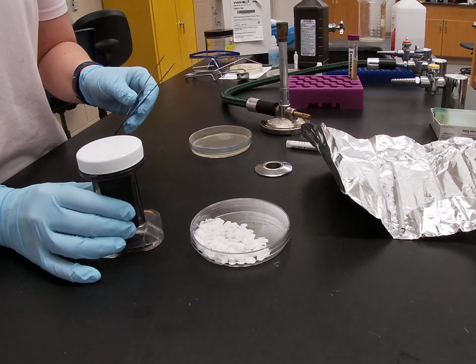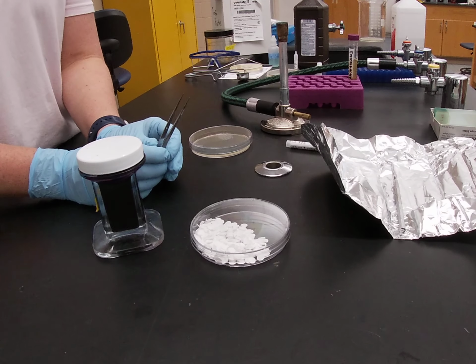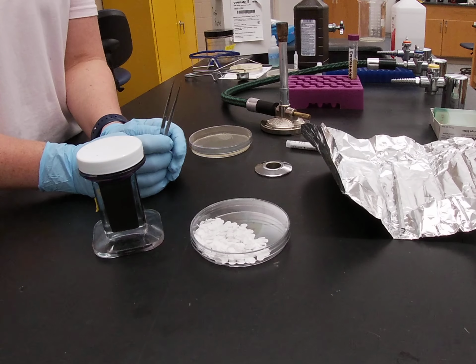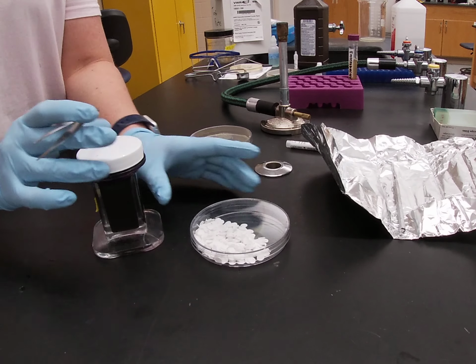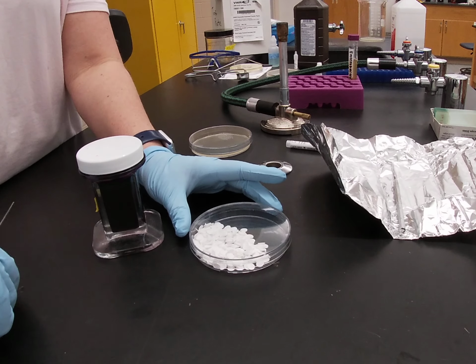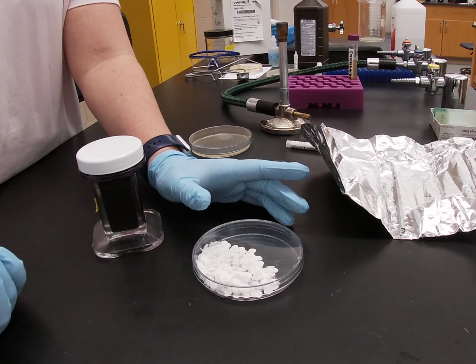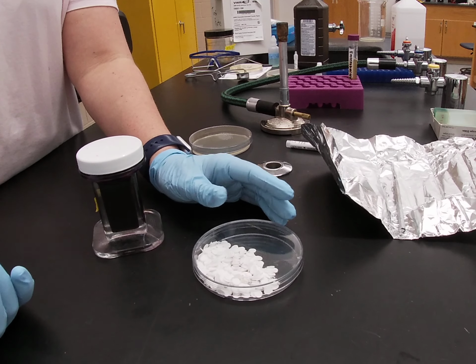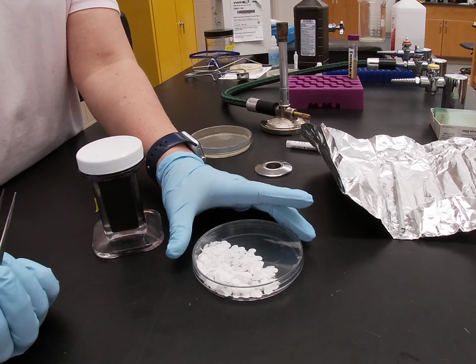So when we are testing the effectiveness of different kinds of antimicrobials like antiseptics or disinfectants, we often will make our own antibiotic susceptibility discs. And we make these using membrane filter paper. Here you can see I have a petri dish that is full of sterilized membrane filters. These have been made and then put through the autoclave to make sure that there is nothing on these discs.